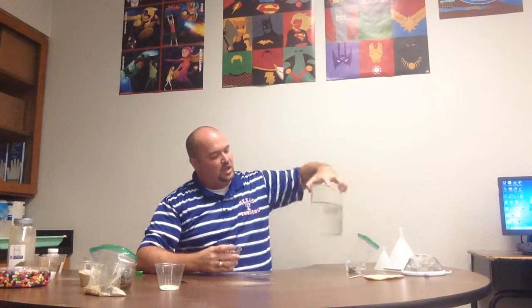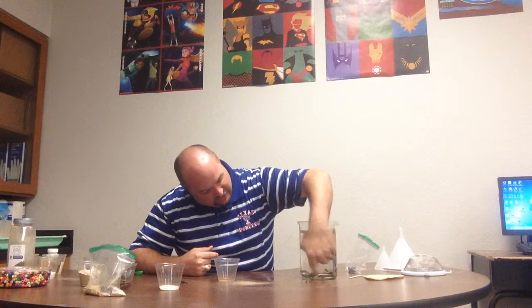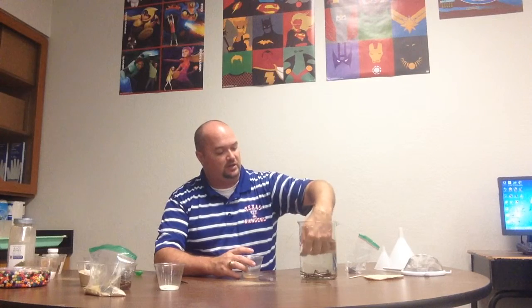Alright, so we've used magnetism. Now, I've got iron nails and toothpicks. So I can use magnetism here, but what else could I use? I could also use density, right? Wood's less dense, iron's more dense. Toothpicks float to the top, iron nails sink to the bottom. A few of my toothpicks got stuck on my nails, but all I need to do is move them around a little bit, let them float up to the top. And my mixture separated.